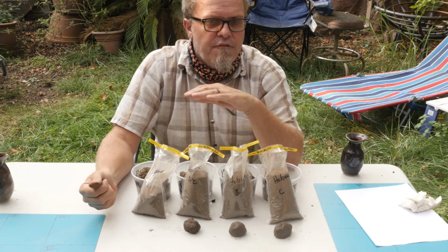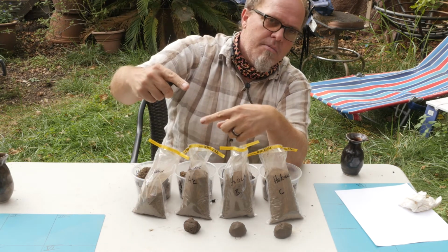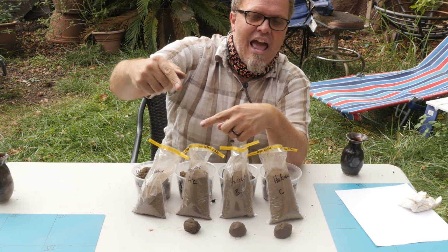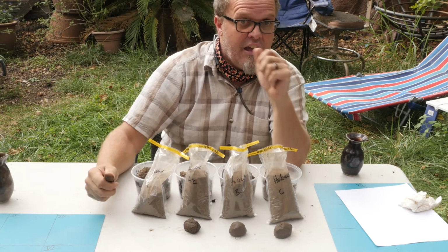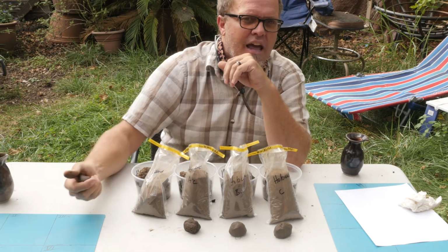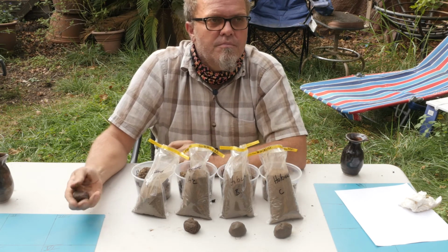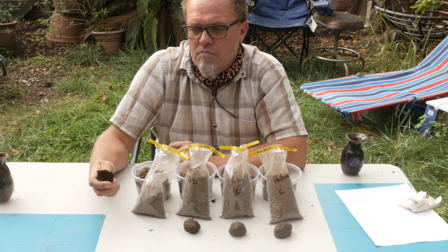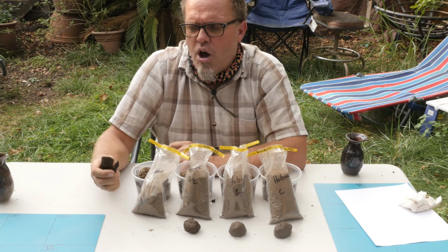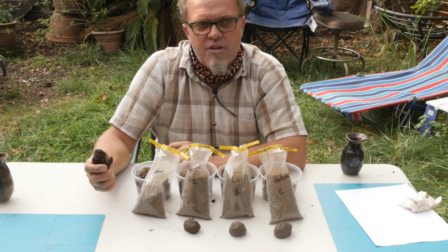We're not going to get to the full spectrum. We'll come back to this later, but sometimes with really clay soils, you can make a ribbon that is 7.5 to 10 centimeters, or 3 to 4 or 5 inches long. This one we got about an inch, about a 2.5 centimeter ribbon. So what happens if we made a ribbon, Irf? Well, the breakout for the ribbon is actually 2.5 centimeters long. So the actual criteria is a weak ribbon less than 2.5 centimeters long. I think we'll go slightly over 2.5 centimeters to make it slightly finer textured than that first cutoff.